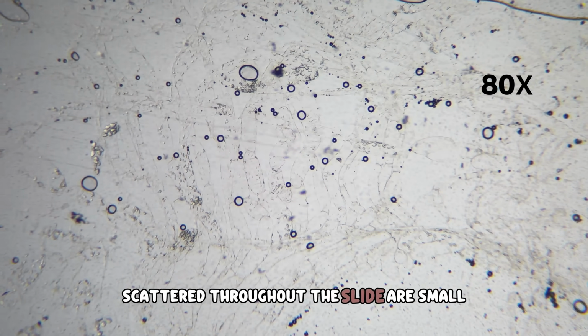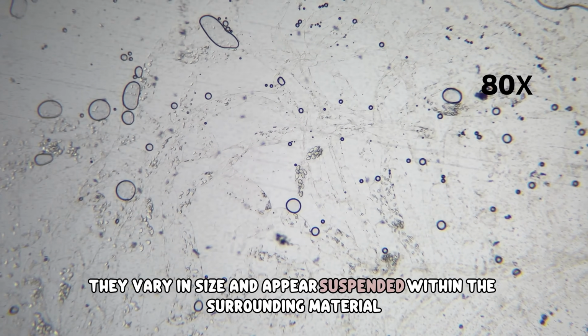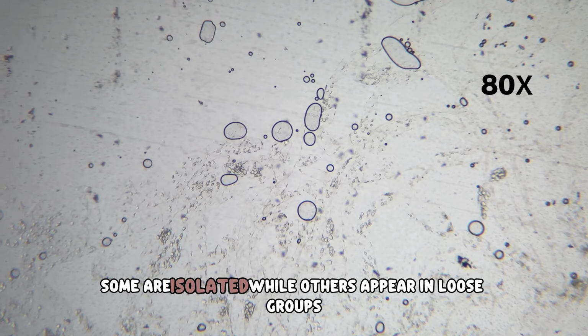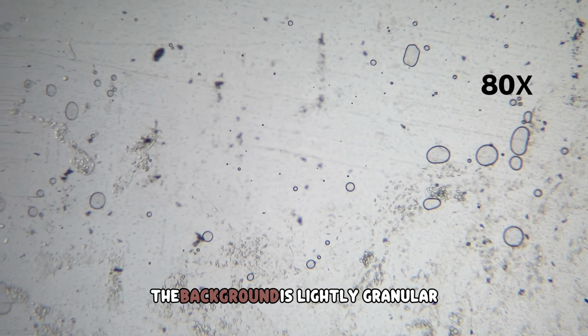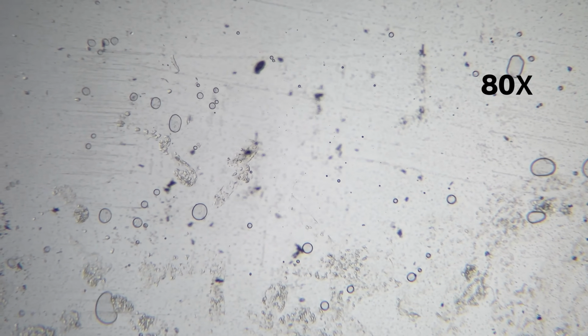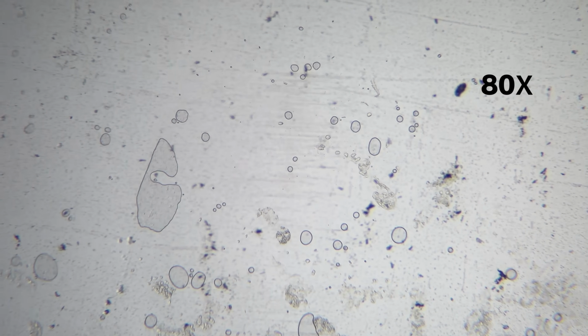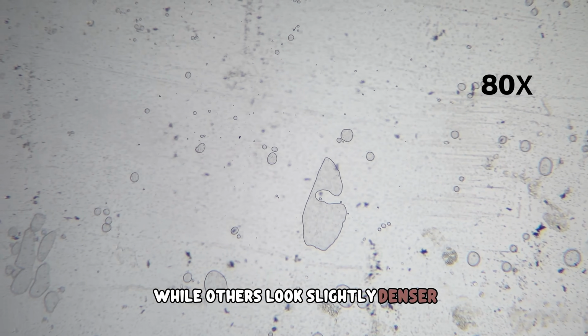Scattered throughout the slide are small, rounded shapes. They vary in size and appear suspended within the surrounding material. Some are isolated, while others appear in loose groups. The background is lightly granular. Fine particles are spread unevenly across the image. Some regions appear almost empty, while others look slightly denser.